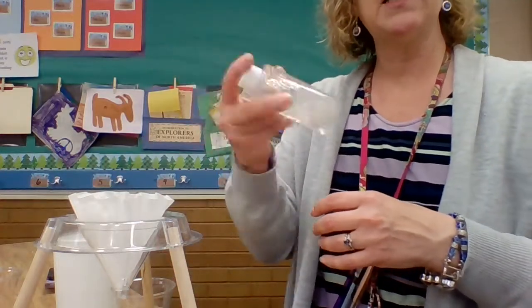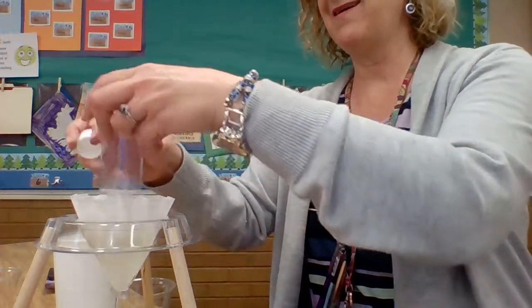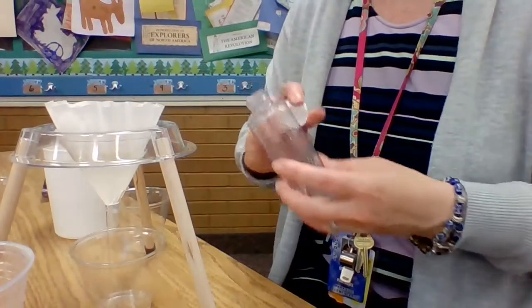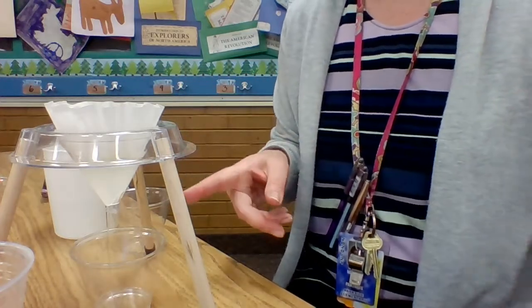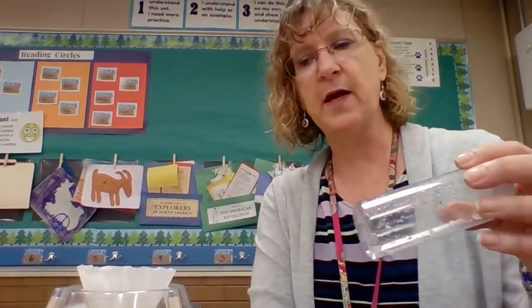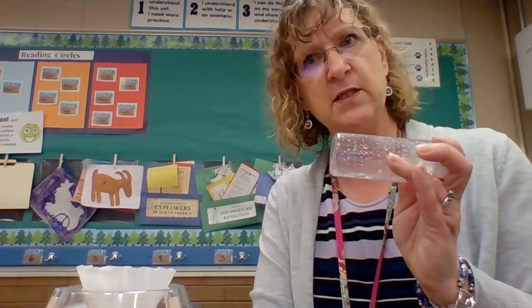So shake it up a little bit to make sure all that solute comes out and pour it through the filter. Now, you'll notice, compared to the last ones, it's running a little more slowly, right? And here you can see some of the solute left in the bottle. And it's running more slowly down there, and it seems a little thicker. And of course, this is a bit of a surprise. And then it's not, because I thought about the fact that I put in 4 scoops. That's the equivalent of 12 of those small scoops. So there's a lot of stuff in solution in here.